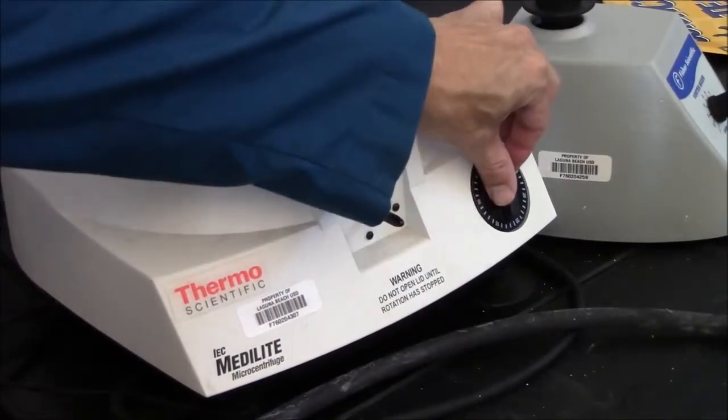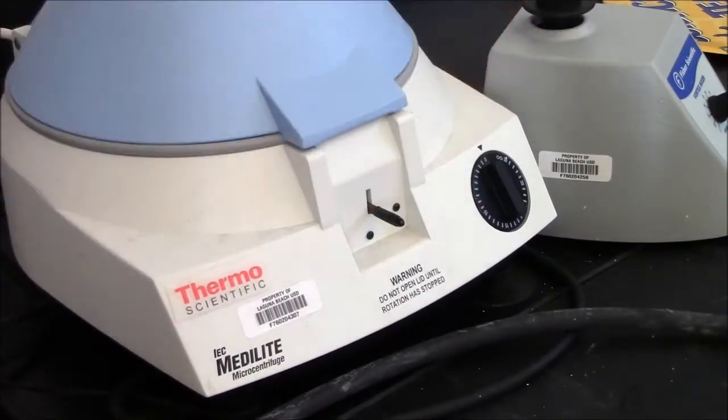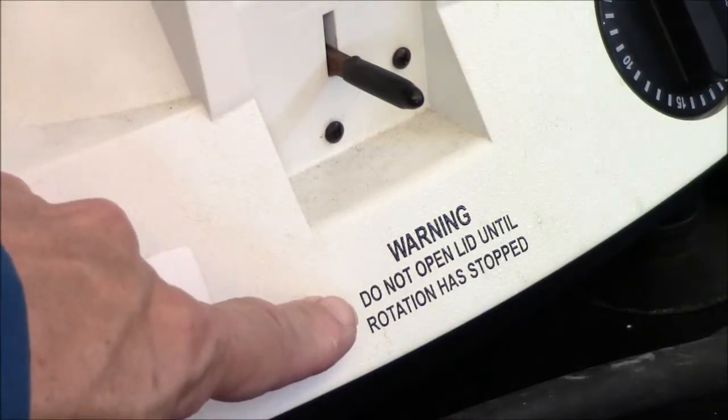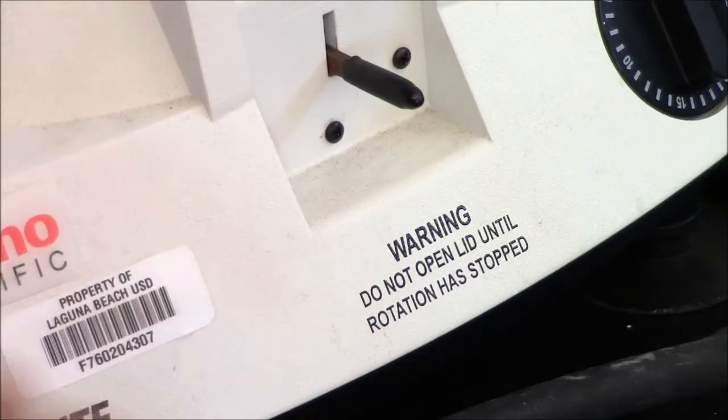It's been a minute. I just turn the dial to turn it off. You can read the warning here: Do not open lid until rotation has stopped.